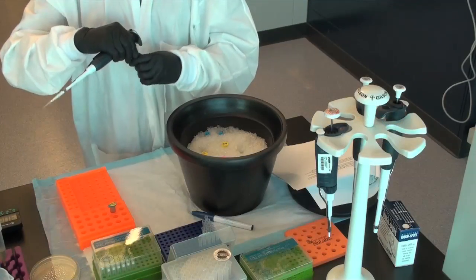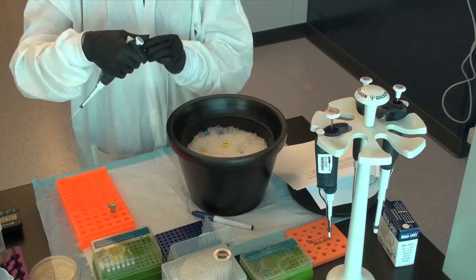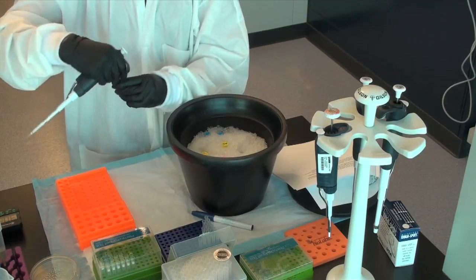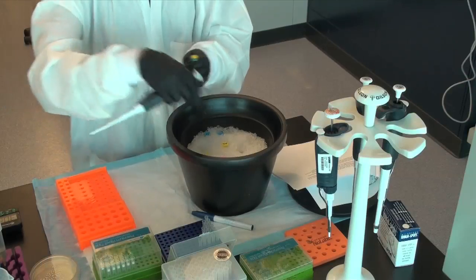Step 7: Add the appropriate amounts of insert DNA and the dephosphorylated vector to a new tube. Label the rest of each tube as un-ligated and store at negative 20 degrees Celsius.